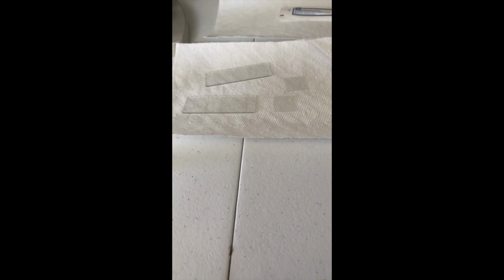Same thing for the plaque. I will grab the other swab, rub it pretty firmly against my teeth, place the swab on the slide, add a drop of distilled water using the pipette, put the slide cover on the slide, and then view it under the microscope. I will take pictures along the way. So with that being said, I'm going to go ahead and get started.